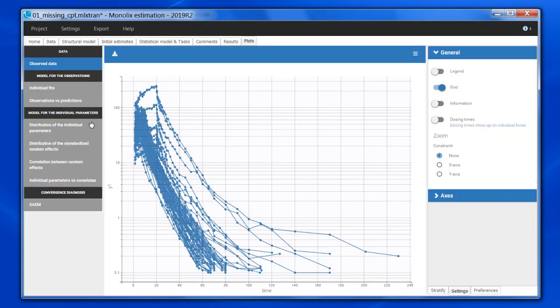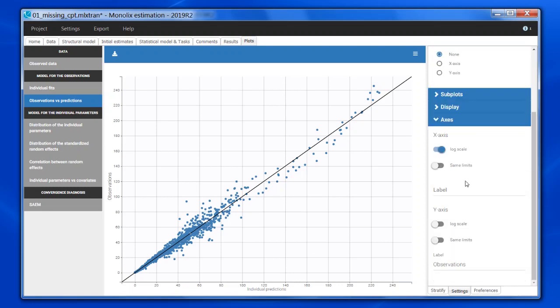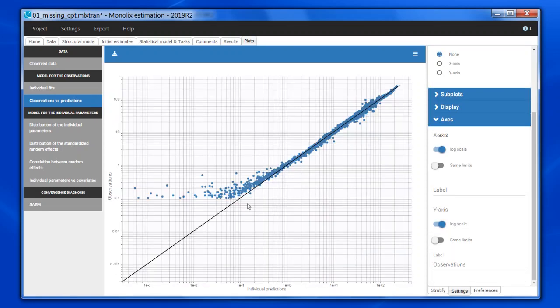If I go to the observation vs. prediction plot, on linear-linear scale it looks okay. But if I change to log-log scale, I can see a clear deviation for the small concentrations. The dots are above the y equals x line, so it means that the predictions are too small compared to the observations.